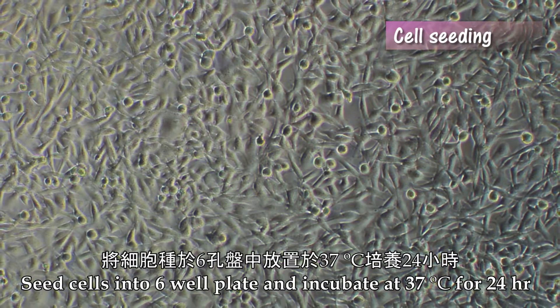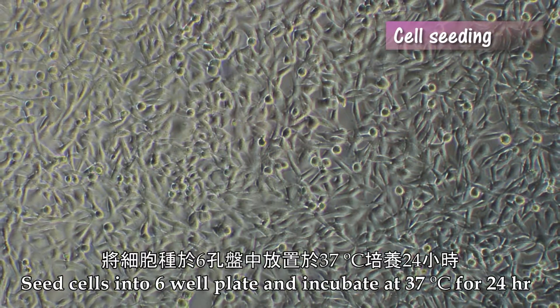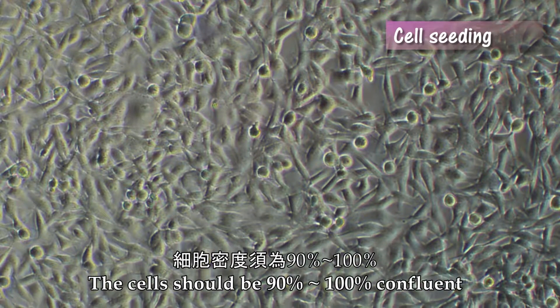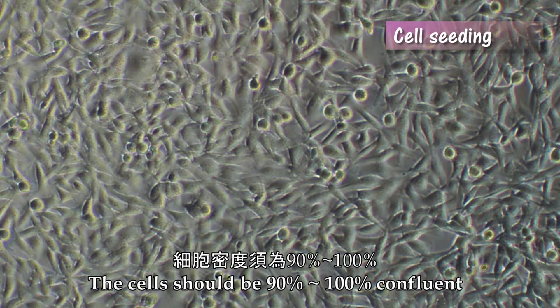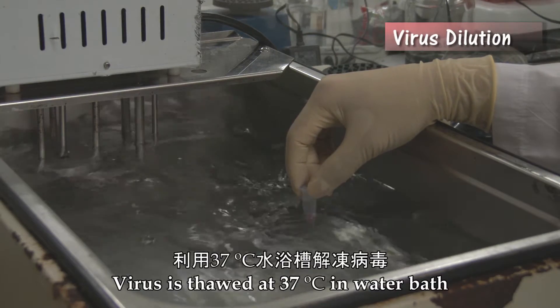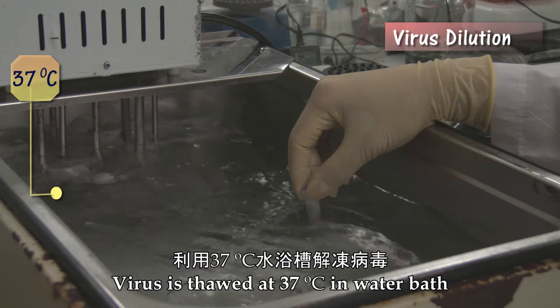Seed cells into a six-well plate and incubate at 37 degrees Celsius for 24 hours. The cells should be 90 to 100 percent confluent. The first step is to dilute virus. Virus is thawed at 37 degrees Celsius in a water bath.